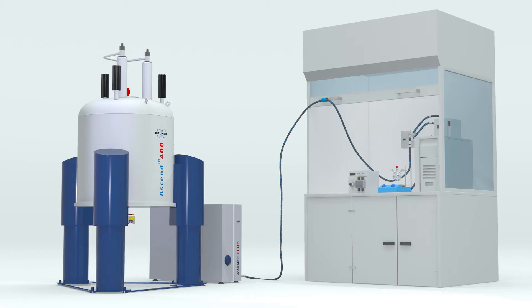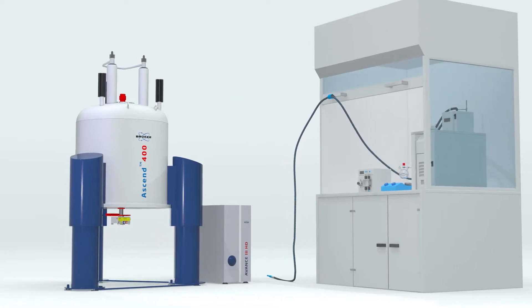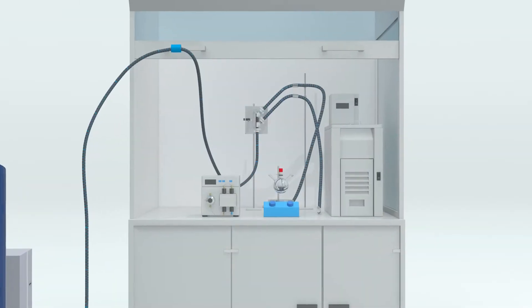Insight MR is the solution to enhance process understanding, and in this video we will show you how to install, insert, and then remove the Insight MR flow unit.